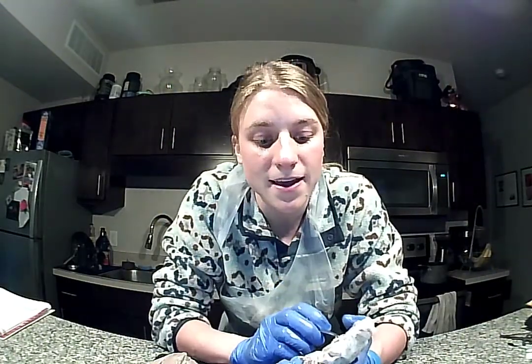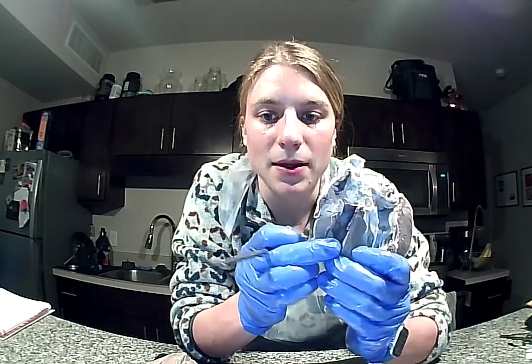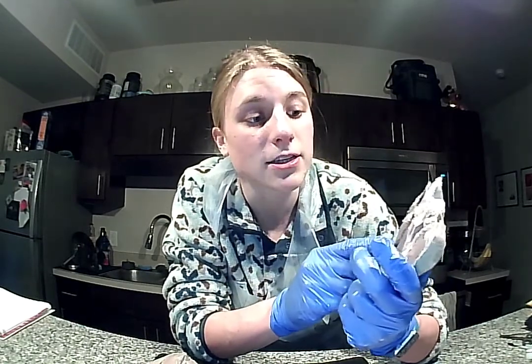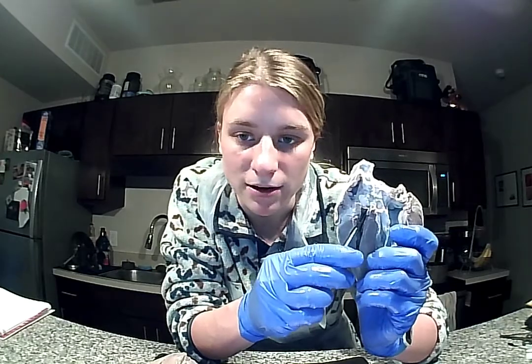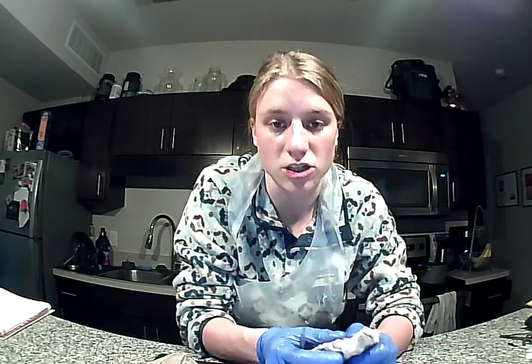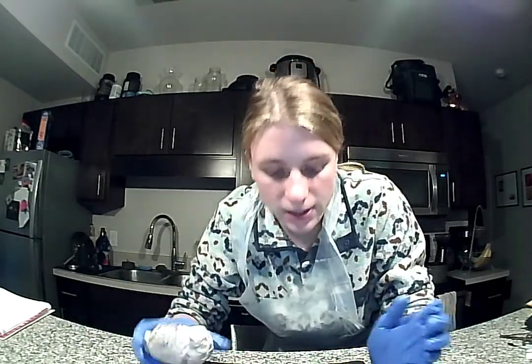And then finally, in the right ventricle, what's going to happen is the deoxygenated blood is going to leave into the pulmonary trunk through the pulmonary valve. And this will just bring deoxygenated blood to the lungs. Next, we're going to go to the other side of the heart.